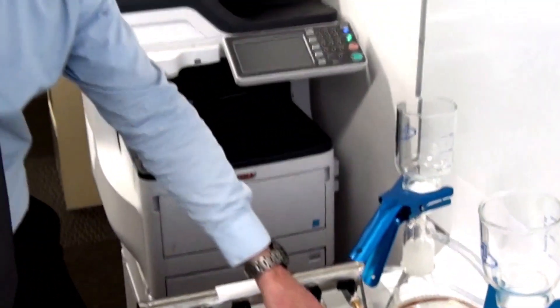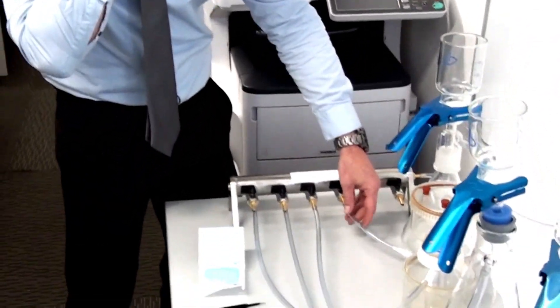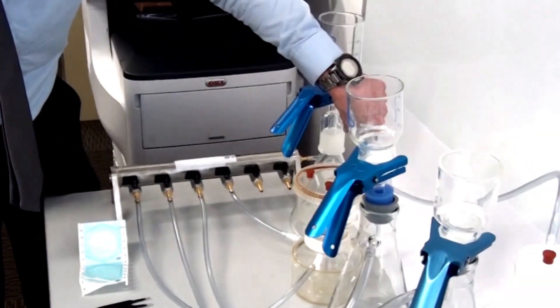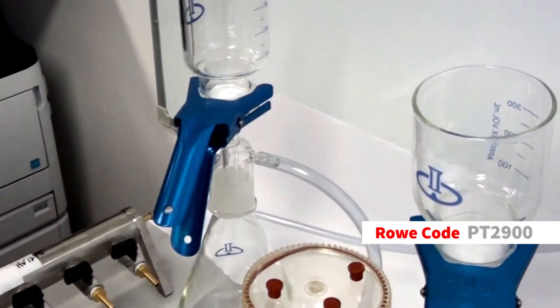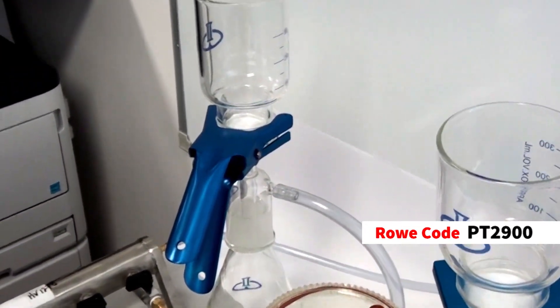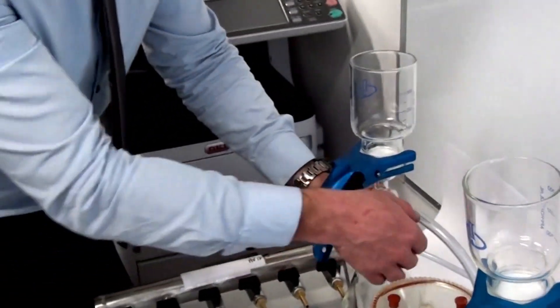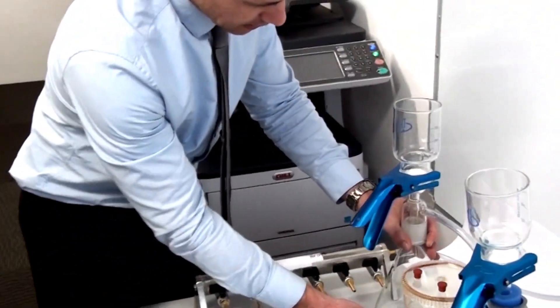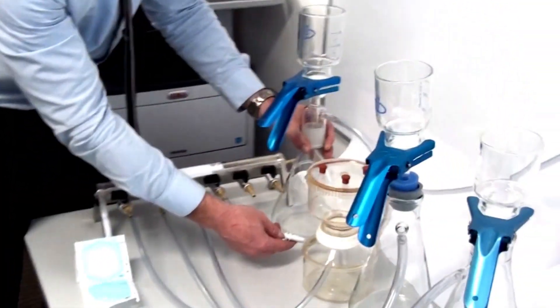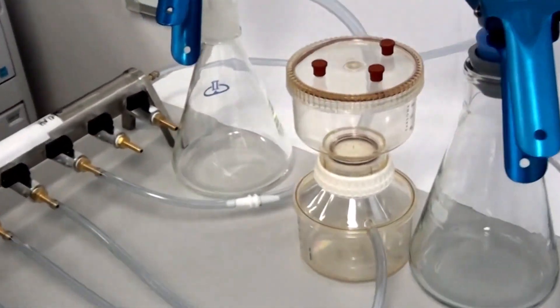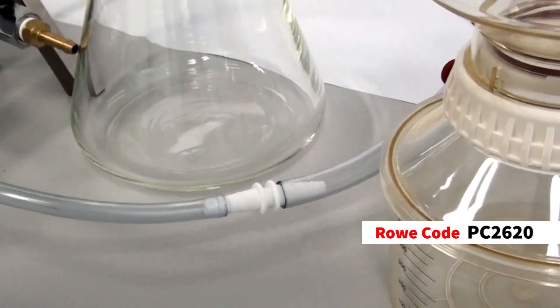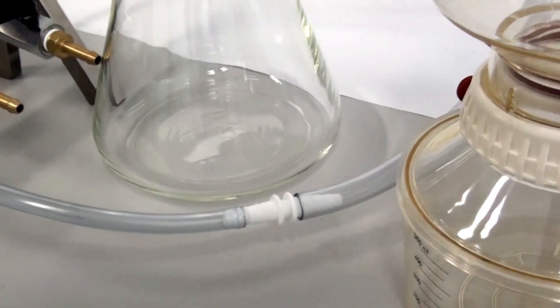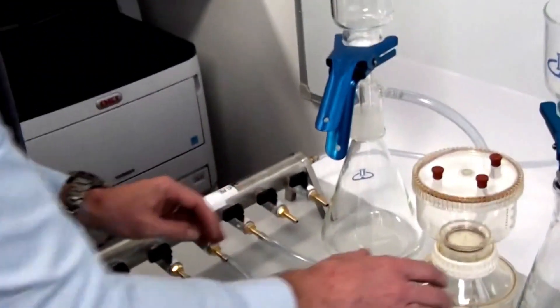So as I said, I've got the PT2800 tubing here, which is 6mm ID. And the neck size here is 10mm. So I've got PT2900 tubing there, which is 10mm ID. And I've had to go through a connector here, which is Roko PC2620.